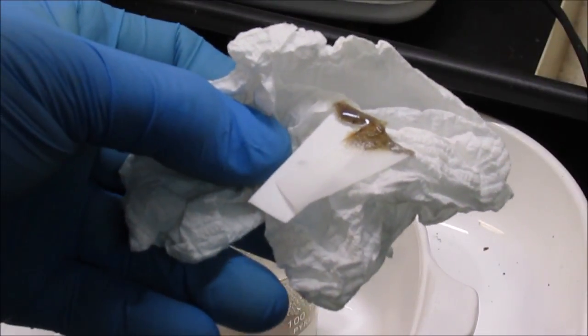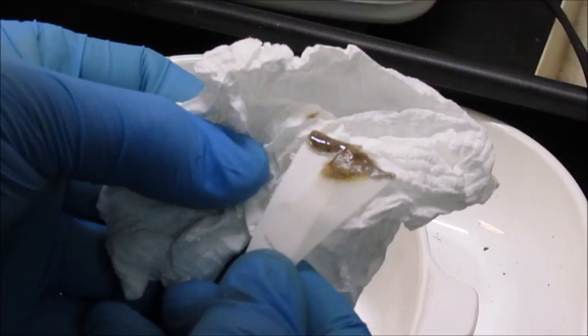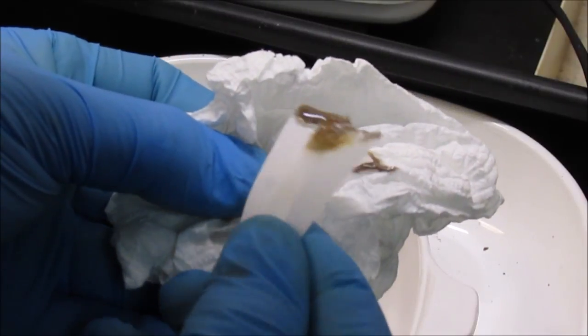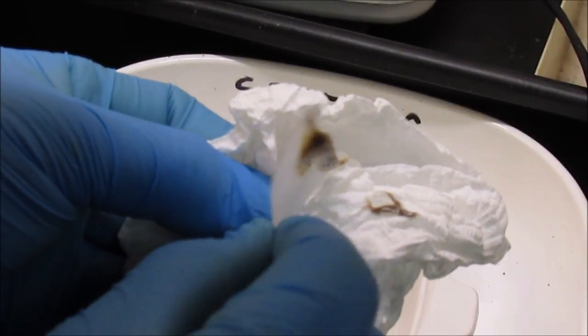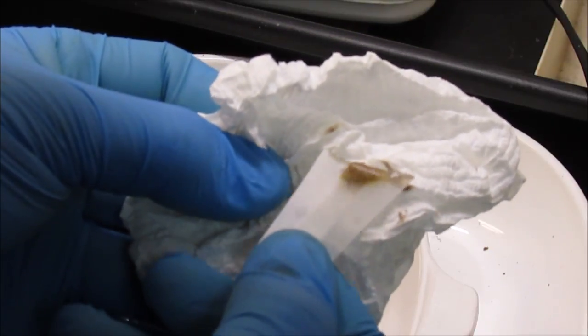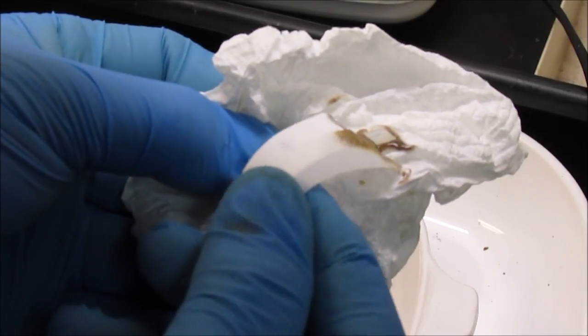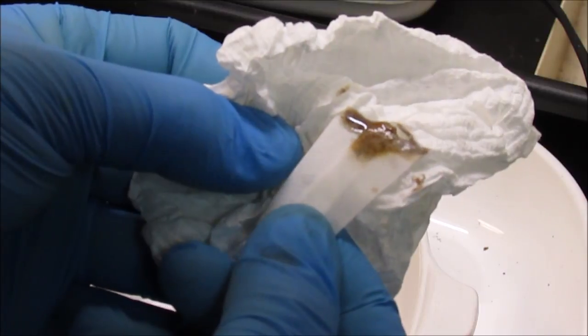When I stuck the paper in there to get a stannous test, the paper went to a jelly-like consistency and just dissolved. The stuff dissolves organic material very rapidly.